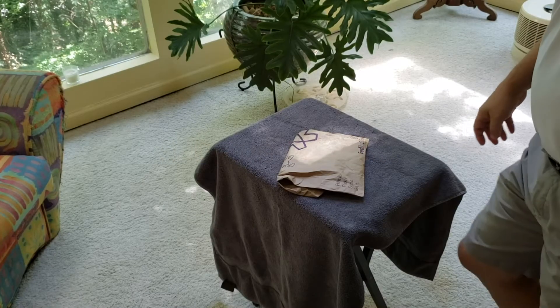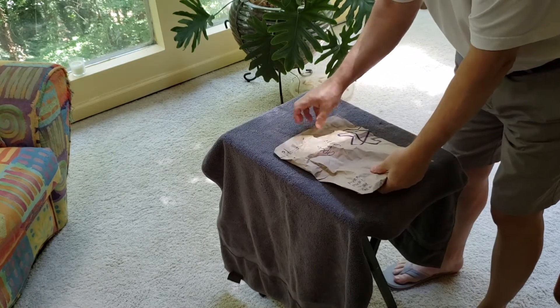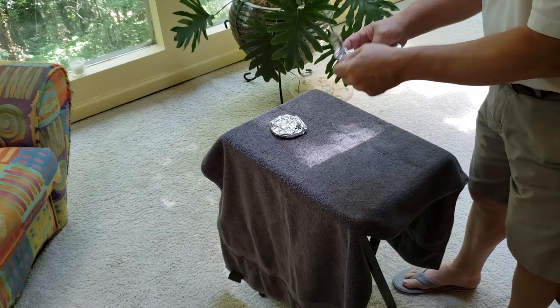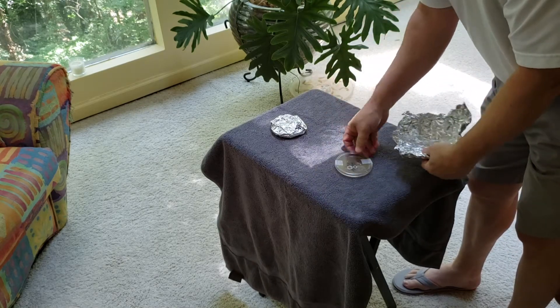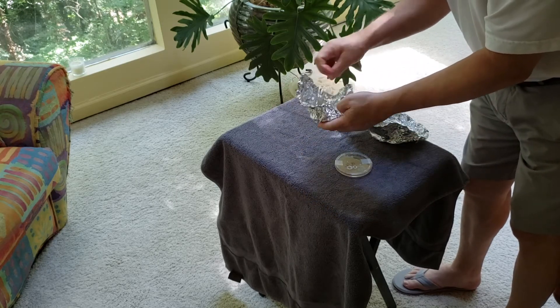Now we are going to wait five days and we will take a look at the results and see what's going on inside those test plates. Okay, it's been five days and now it's time to open this up and see what's going on. That's the regular one, and this one is the tap test.